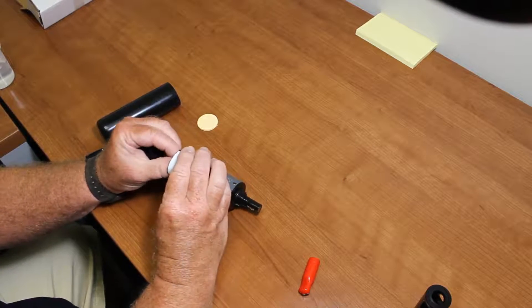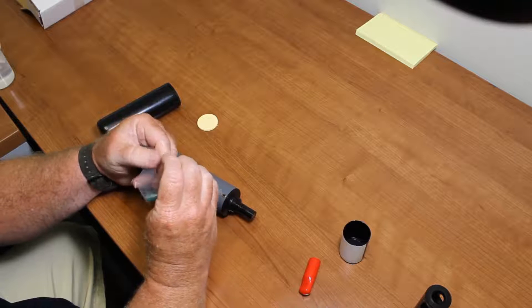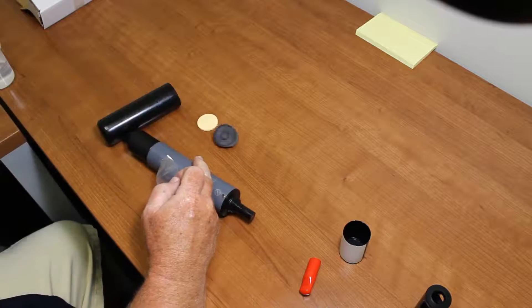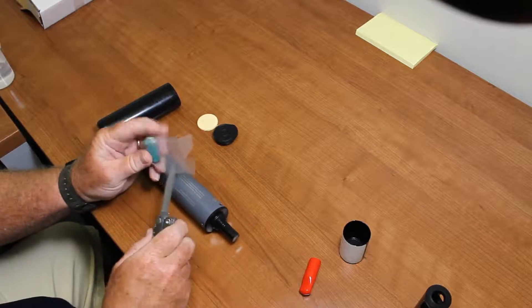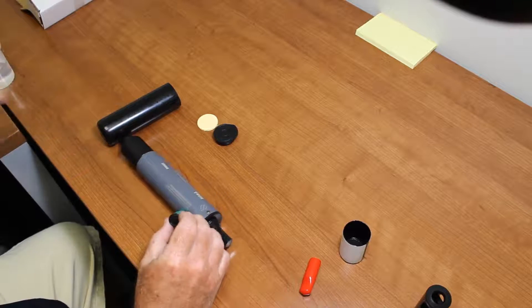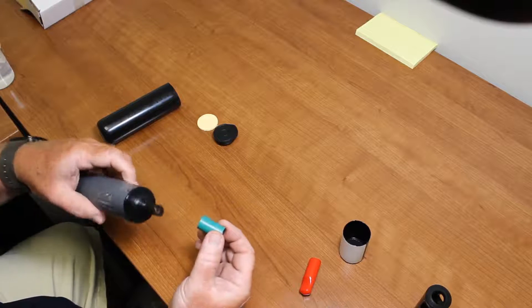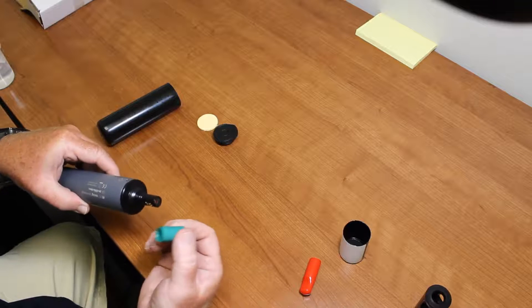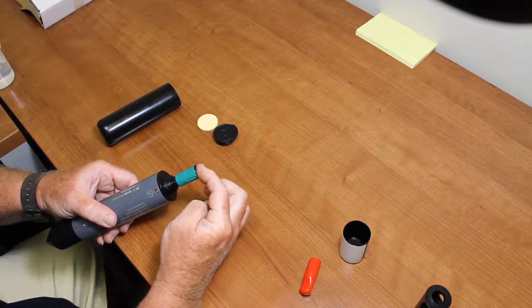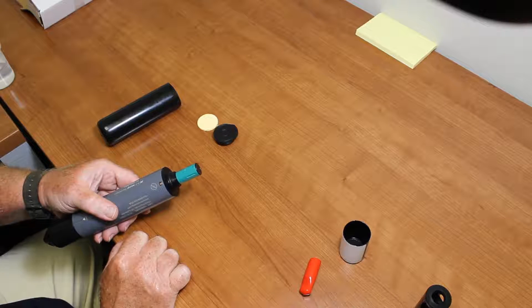There's the sensor itself — the optics here and the electrical contacts here for the cap. So we want to install that cap. That seven months — actually six months plus a month — countdown starts right after you launch or initialize it when you calibrate it. Here's the cap, and we want to make sure we're installing it the right way. There's an arrow and a flat spot inside that lines up with the contacts. It just pops on like that. Now our sensor cap is on.